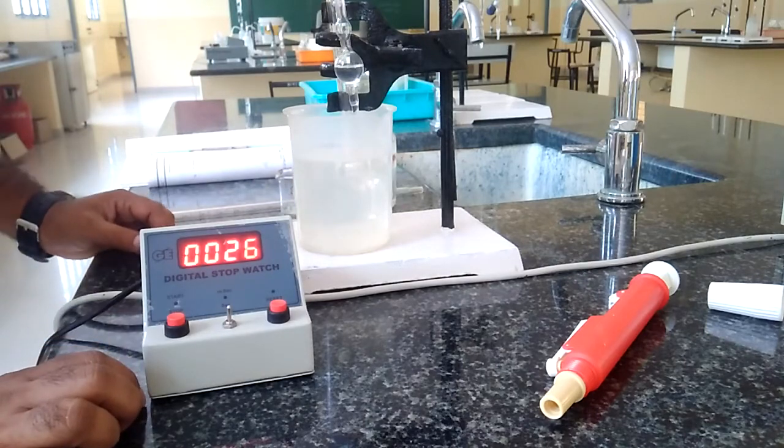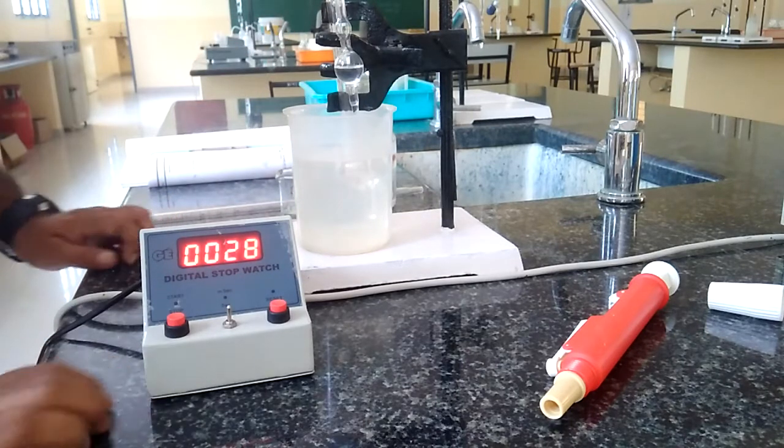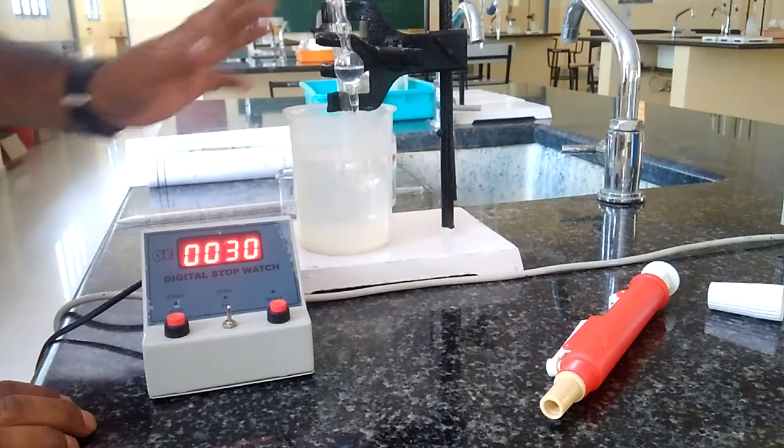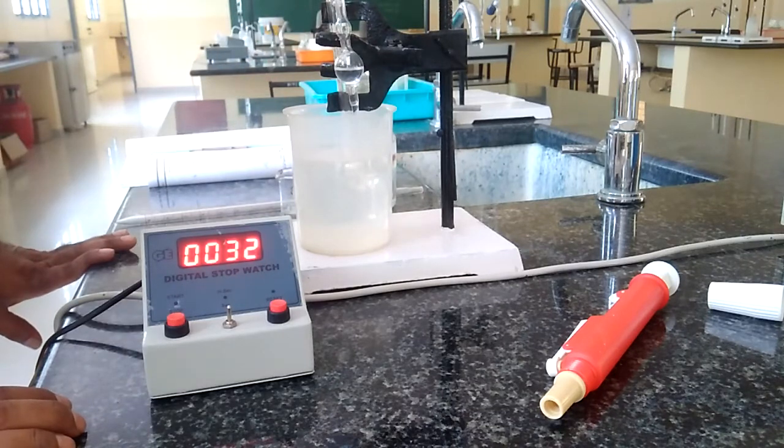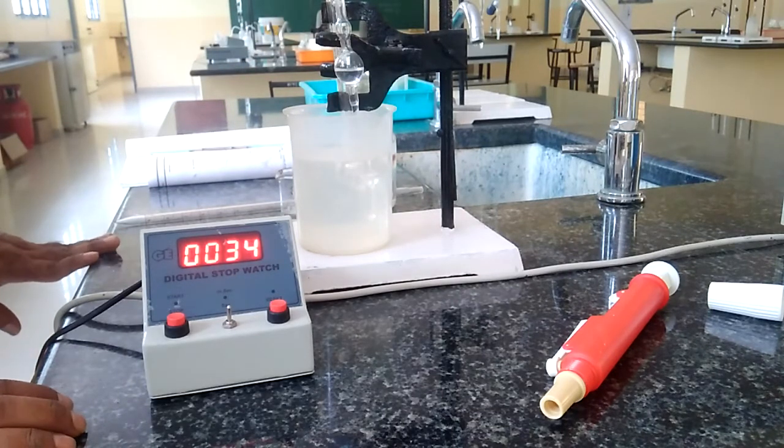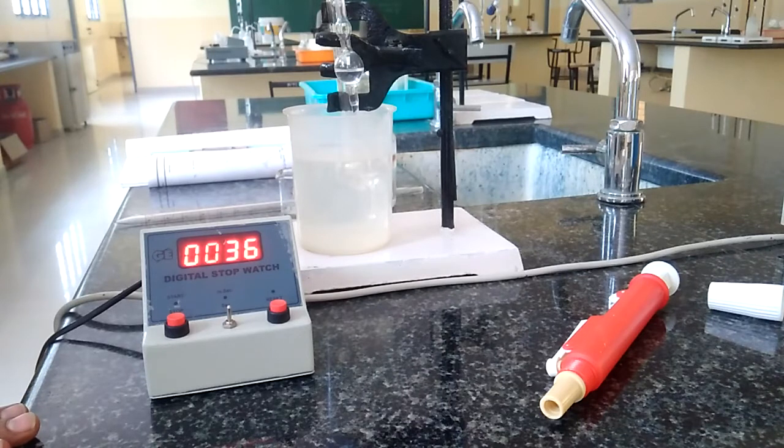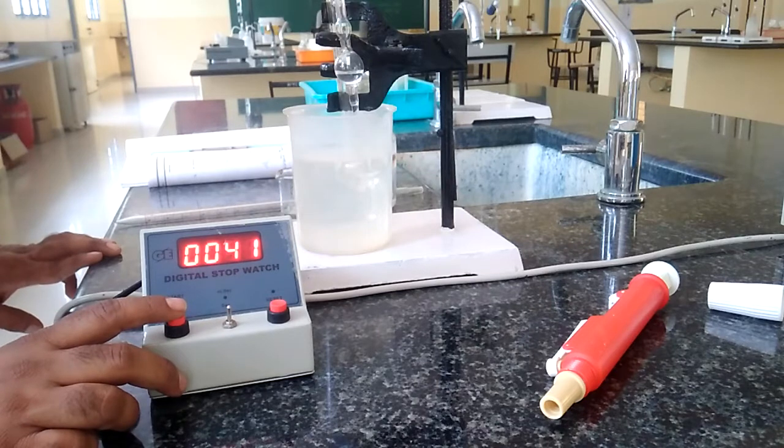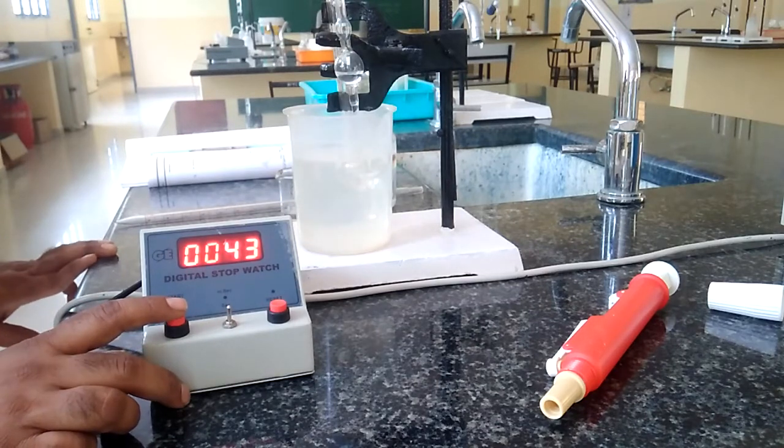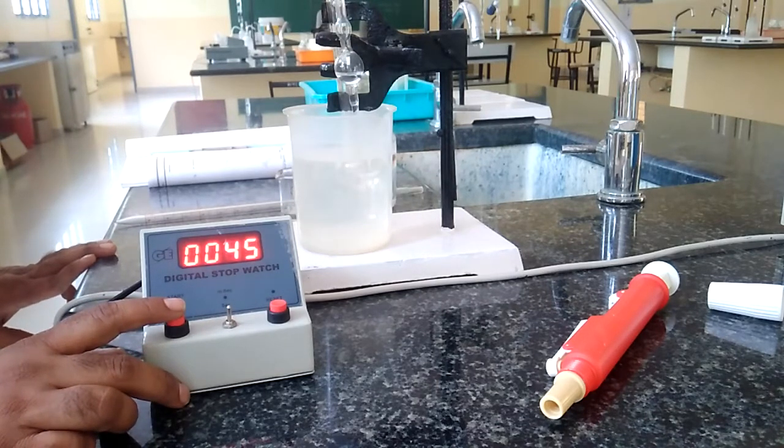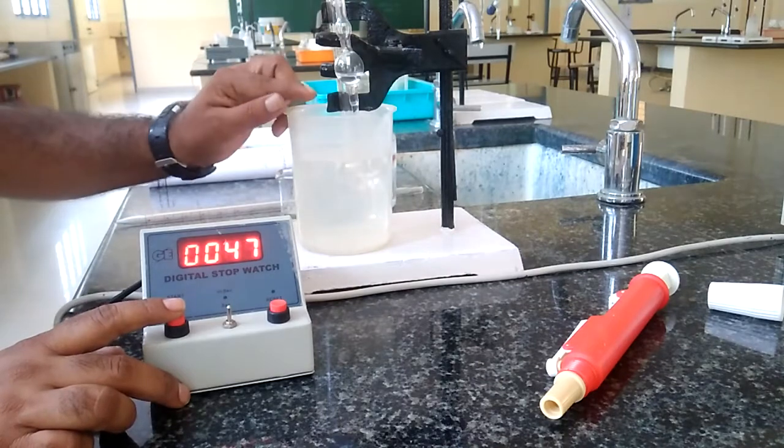It's moving slowly. That movement of the liquid is depending upon the capillary tube present inside this viscometer, coming down.